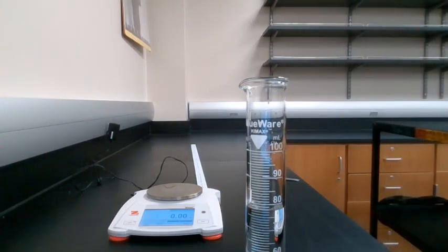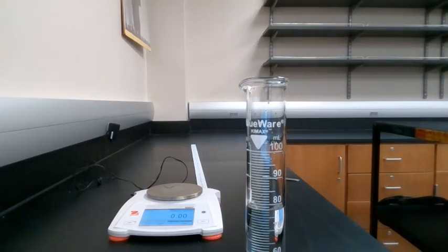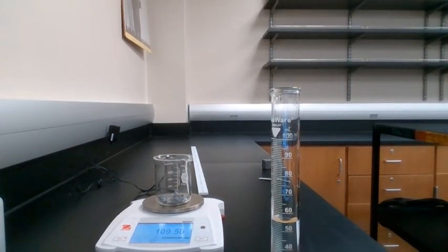Now you have to calculate what the volume of the metal was, and we're going to do that in the exact same way that we did for tin. We're going to just take our final volume of water minus our initial volume of water, and that difference in volume is actually the volume of our sample. Now all you have to do is look up what the atomic number for lead is.